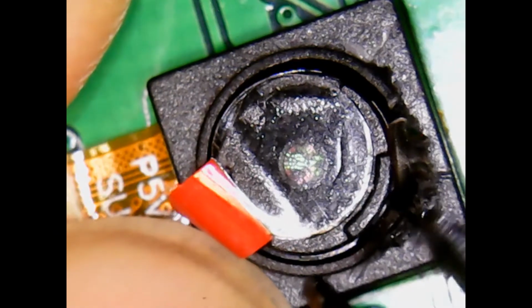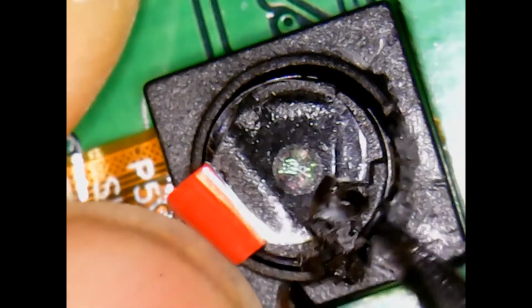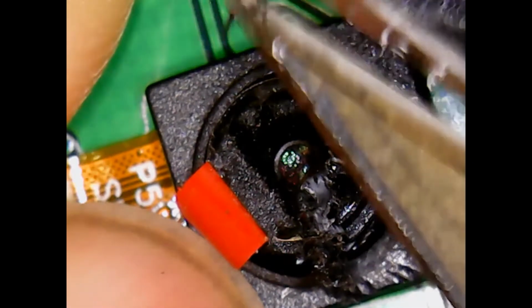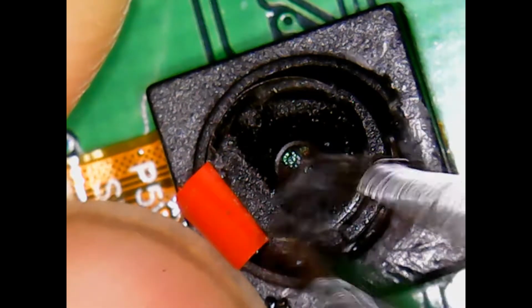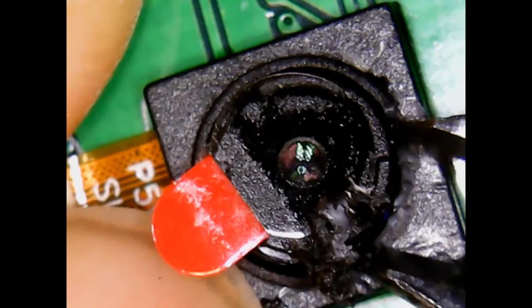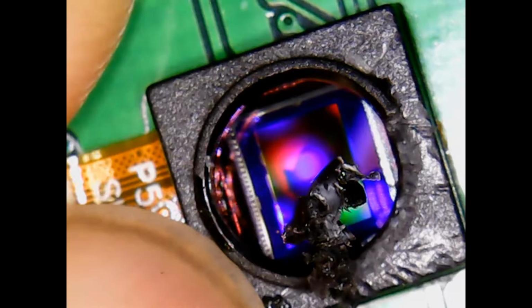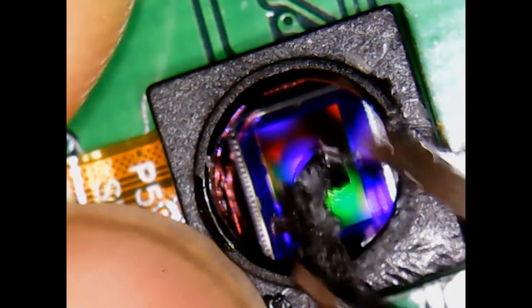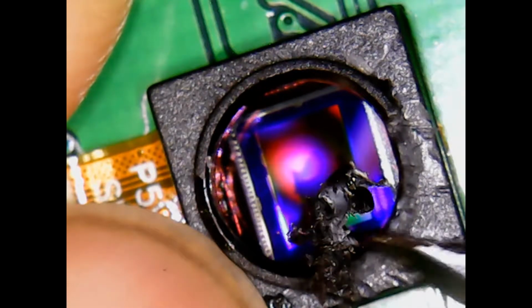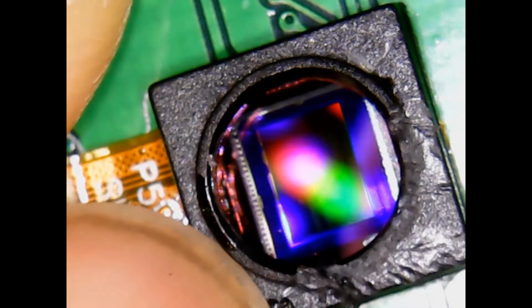That's a good sign. So chew around, and when you're almost about halfway chewing, and we move it down here, this lens just wants to pop up, and I'm going to pry it up. Now you've got to be really careful that you don't let this tool, which is metal, slip inside there and scratch the glass. So again, very controlled movement. I'm prying it. Oops, it's like a loose tooth now. So I'm just going to grab it and push it away. Boom. Okay, so now the lens is good. If these little pieces of plastic fall in, no problem. They won't scratch the glass. But if your tool jabs in there, you'll scratch the glass, and that'll be a permanent mar on your microscope.